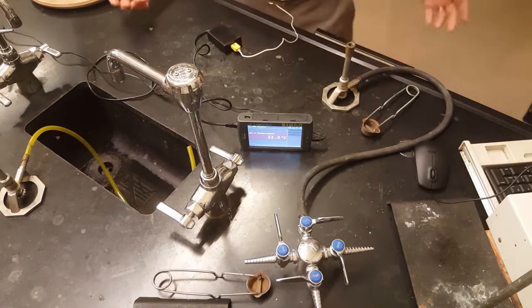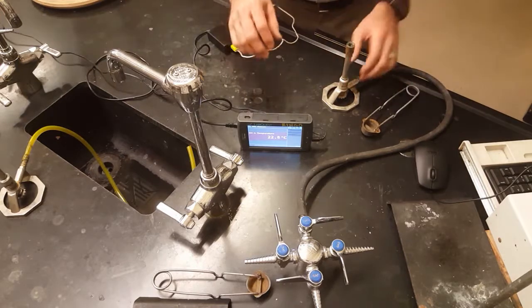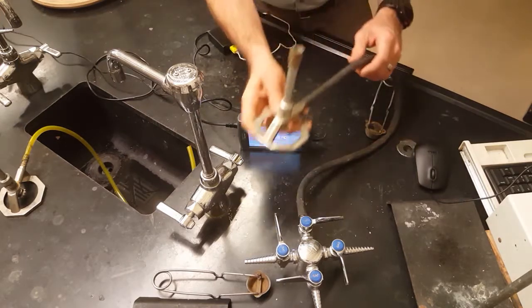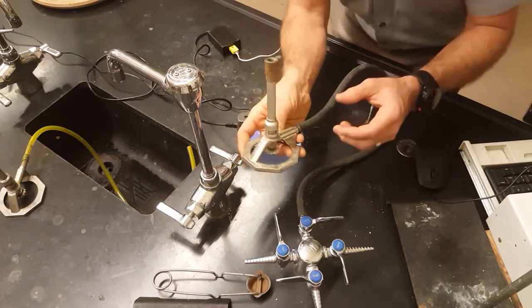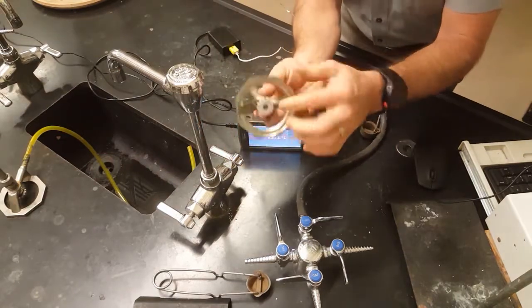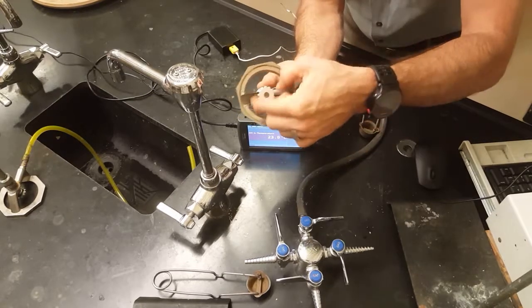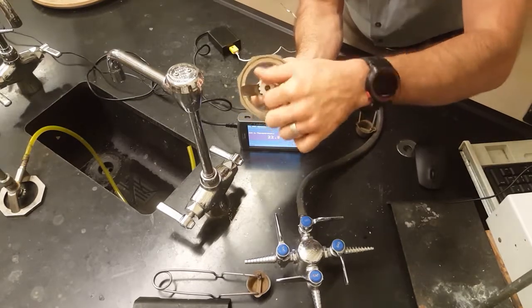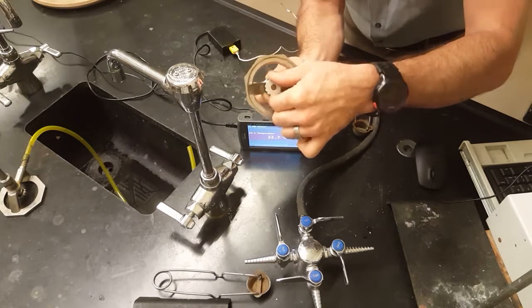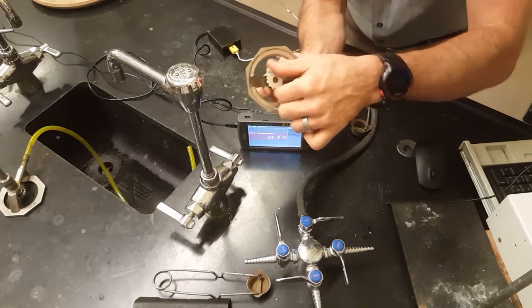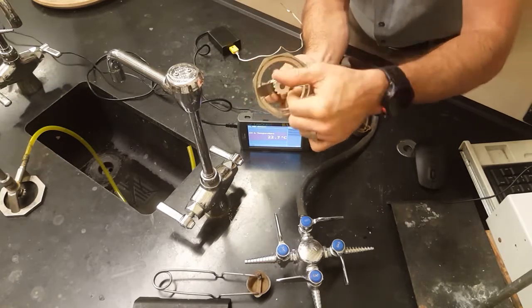Hi guys, welcome to the Bunsen burner lab. This is last chance Bunsen burner school. Here's your Bunsen burner. Let me show you its features. This spindle valve on the bottom is for fine-tuning your gas flow, so righty tighty, lefty loosey. Turns the gas off, turns the gas on and higher and higher, more gas and more gas, less gas, less gas, less gas.